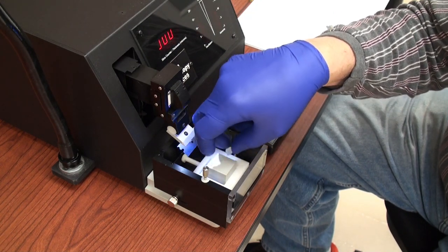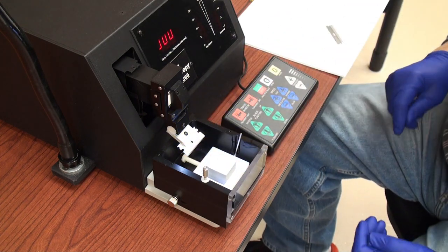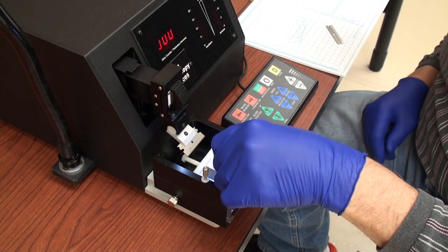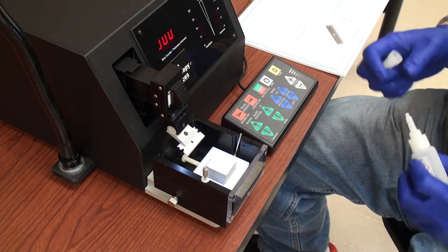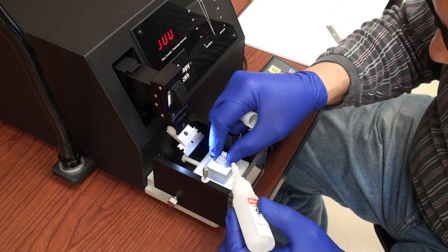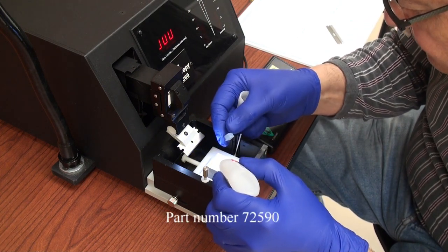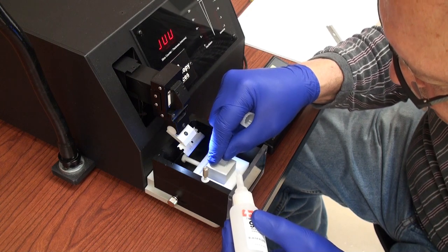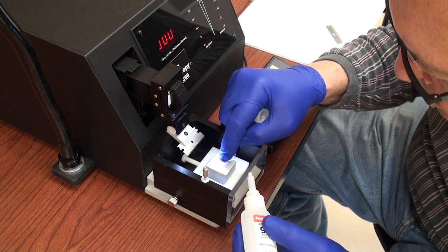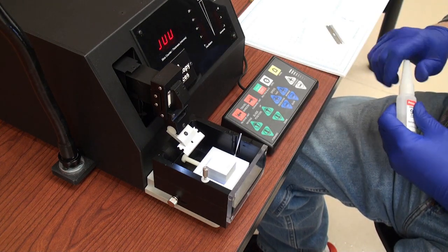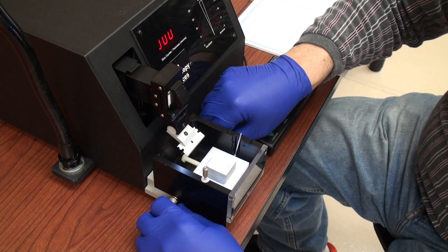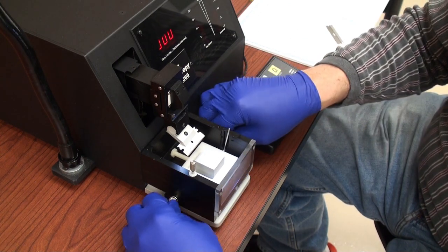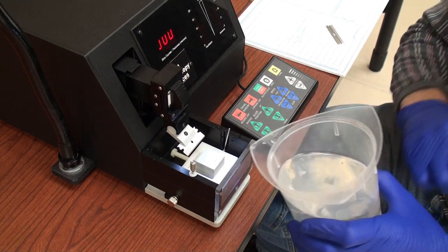Always being mindful of the cutting edge nearby. The size of a typical rodent brain. So I have some what we call tissue adhesive. Loosen the screws on the side of the tray. Slide it forward.